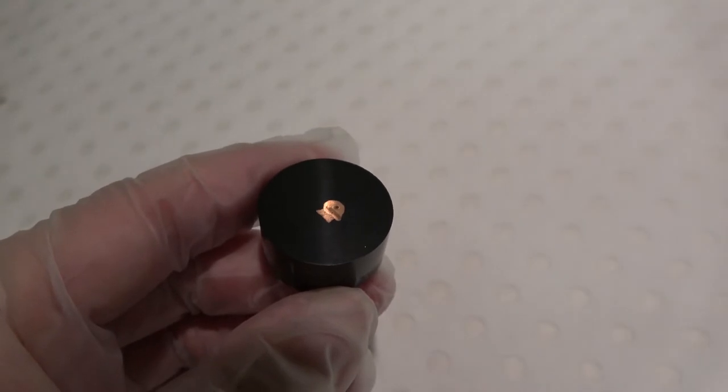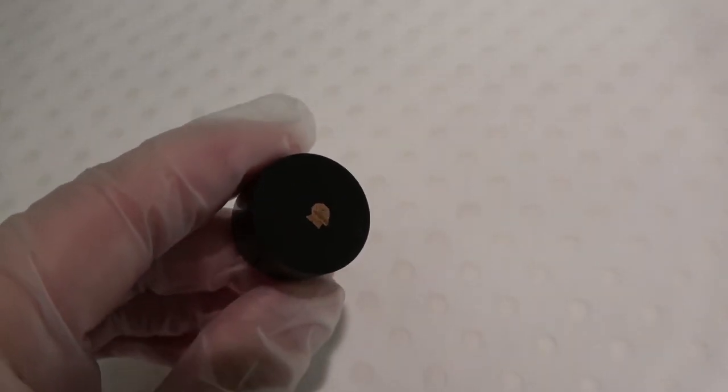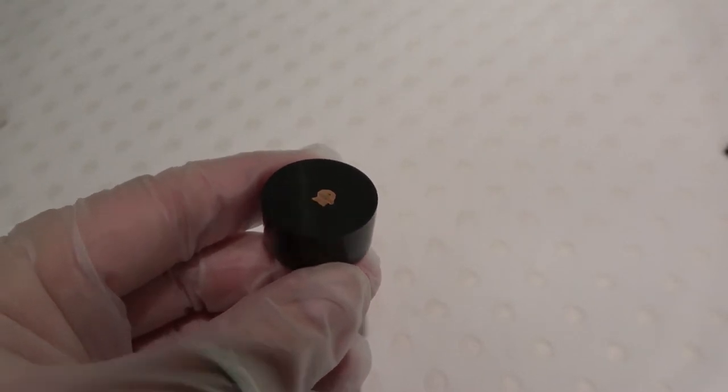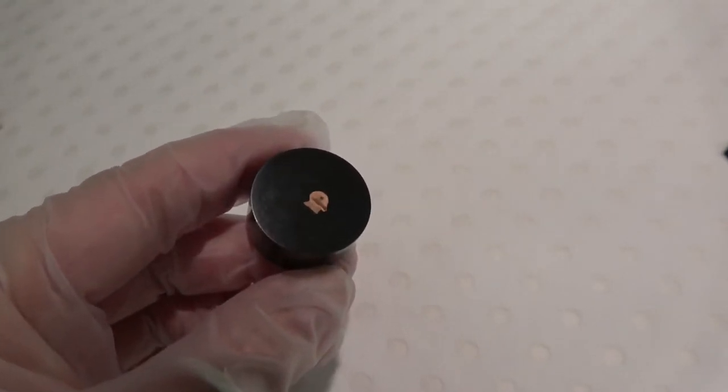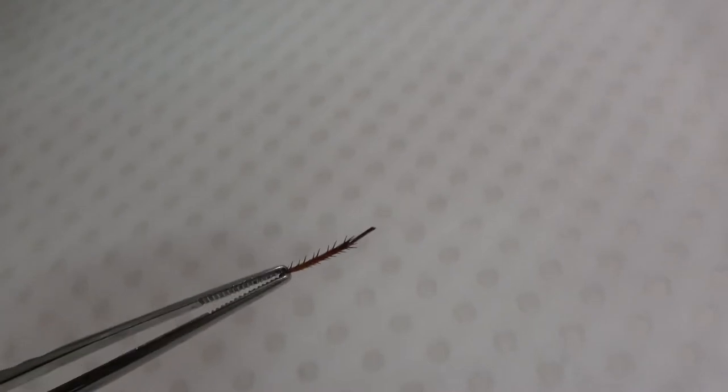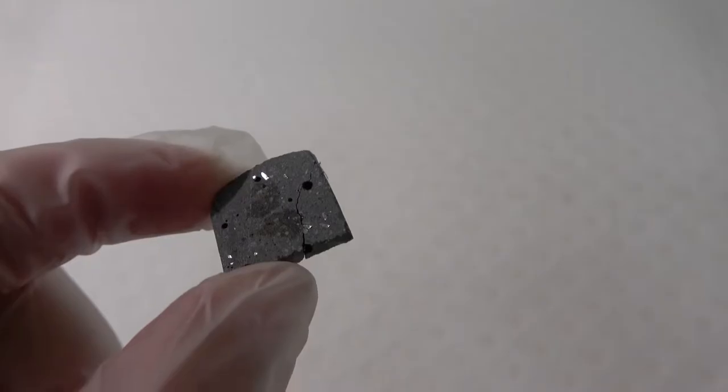By bulk samples, we mean a solid piece of material that can be manually manipulated with gloved hands, tweezers or forceps. Examples include samples in polished resin blocks, petrographic thin sections, wafers, glass, insect parts, and industrial materials such as metals or mineral composites.